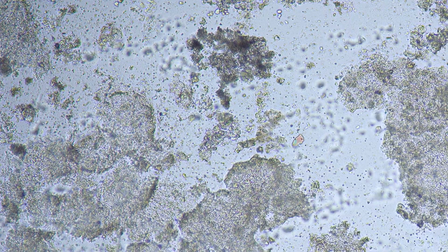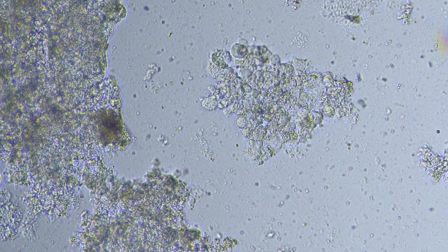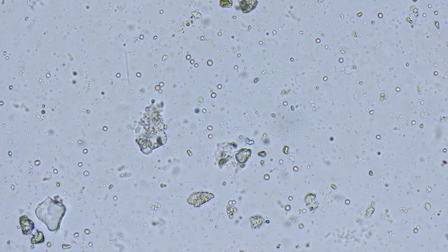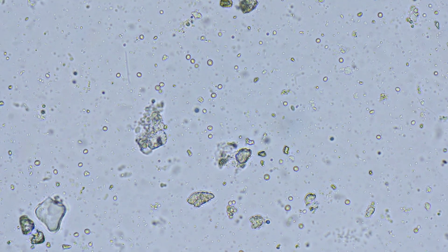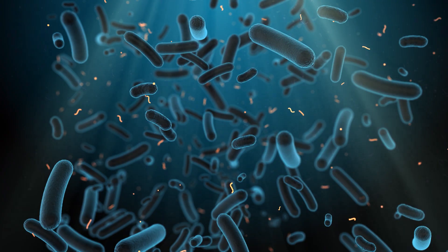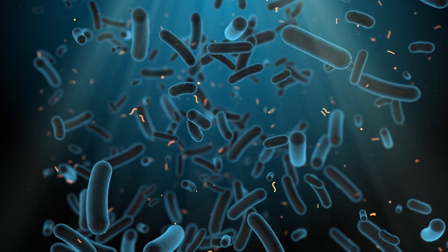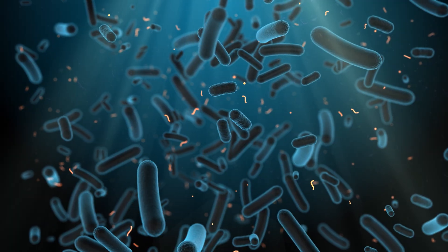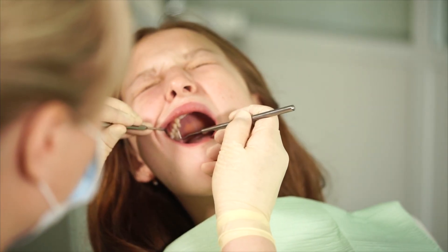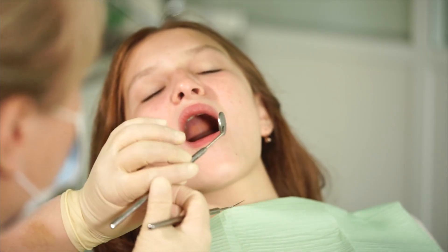Under a microscope, you'll see food debris, toothpaste residue, bacteria, fungal spores, and sometimes even single-celled organisms wiggling around. A study once found an old toothbrush can harbor over 10 million microorganisms, including E. coli, Streptococcus mutans, and Candida albicans — familiar culprits behind gum inflammation, cavities, and oral thrush.